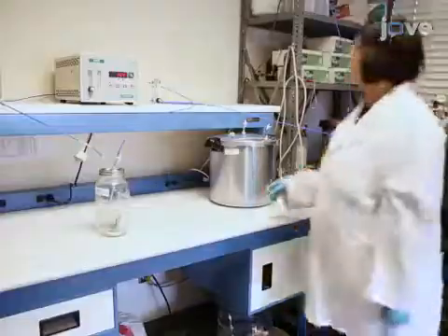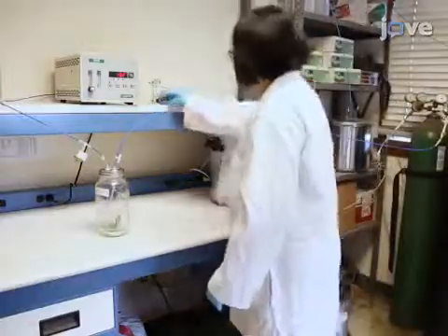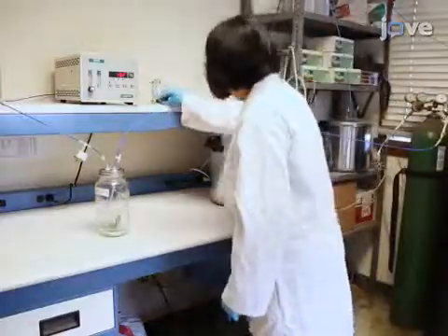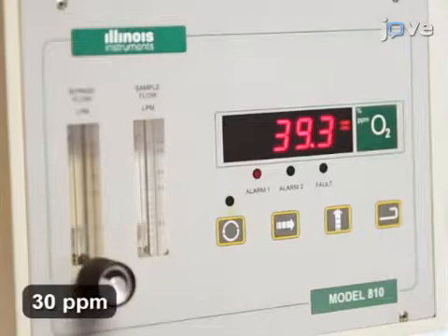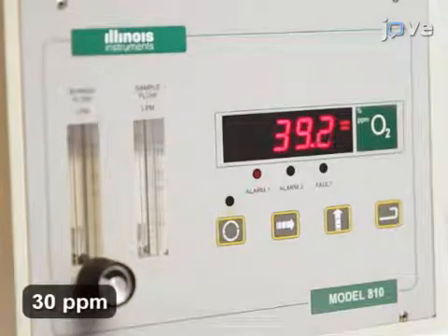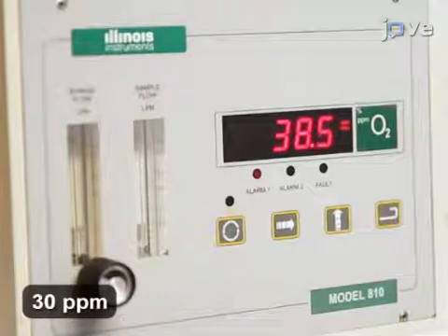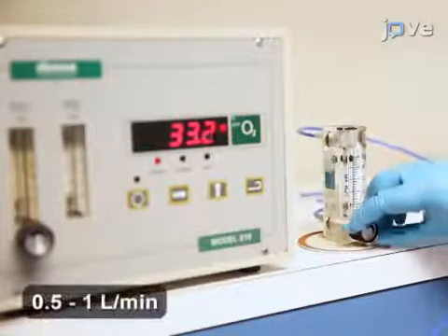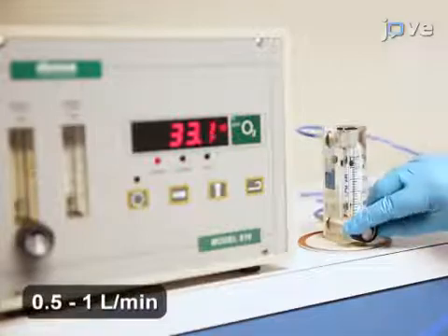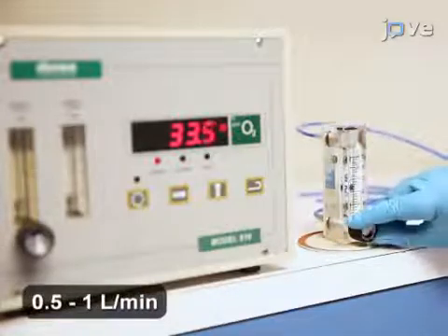Now, flush the chamber with nitrogen to establish an ultra-low oxygen atmosphere. Start with a high flow rate. Then, when oxygen levels are close to 30 parts per million, reduce the flow rate to between 0.5 and 1 liter per minute.